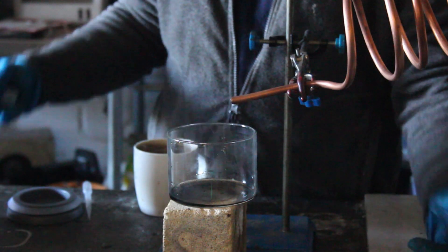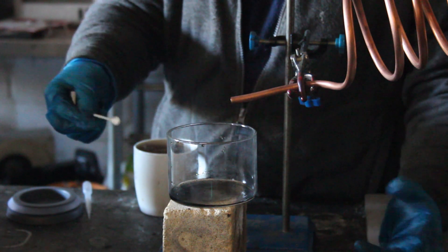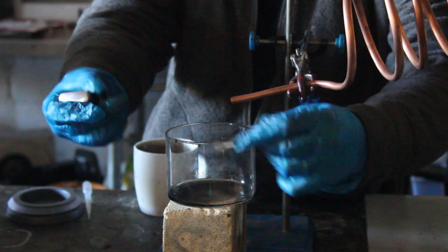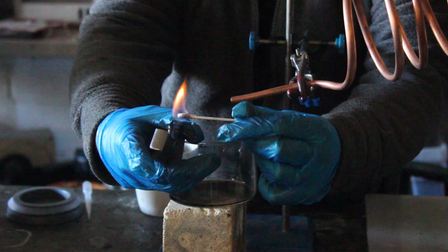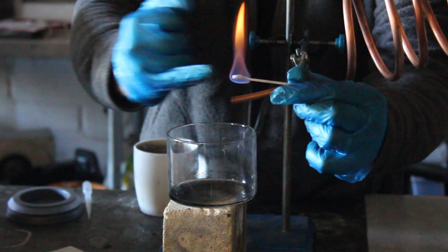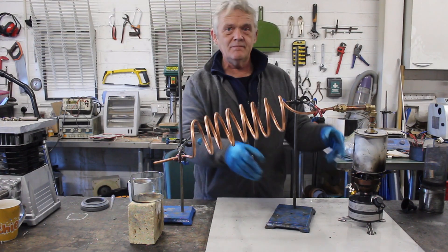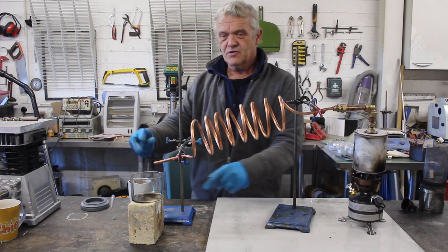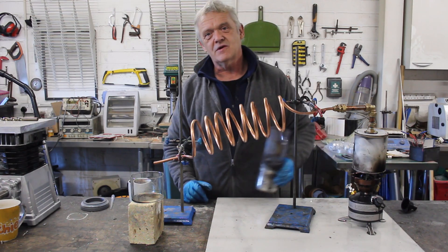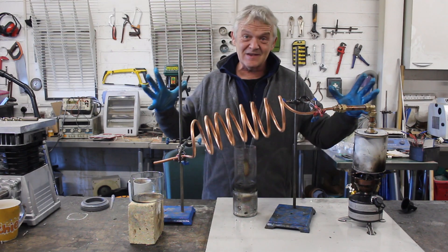Remember, the first bit that comes off is going to be water and you throw it away. It's after it gets to 300-400°C that it's going to start being methanol. You can test that easily enough just by dipping in a cotton bud and lighting it — if it's water it won't light, if it's methanol you'll get that characteristic blue flame. So there you go, making your own methanol. It depends on which wood you put in, setting up a distillation, throwing away the first bit of water, and then collecting the rest.